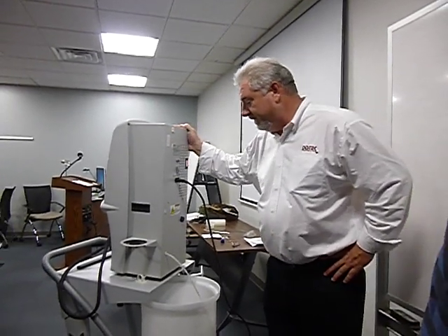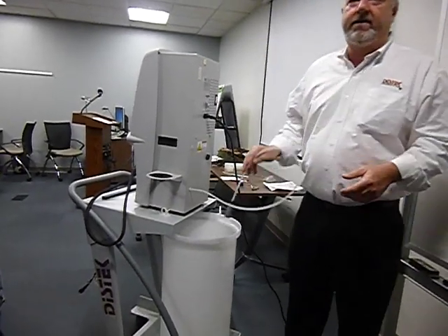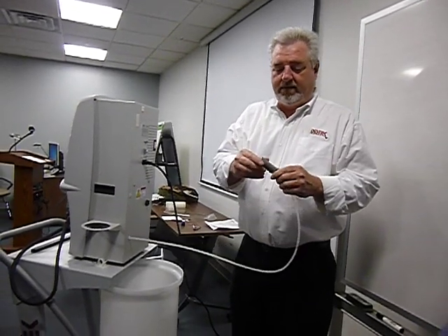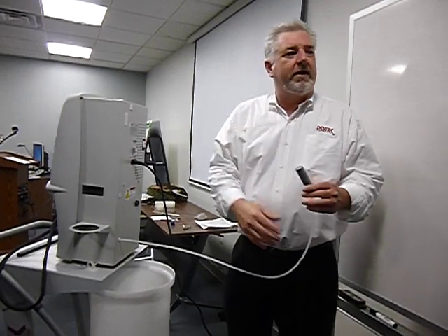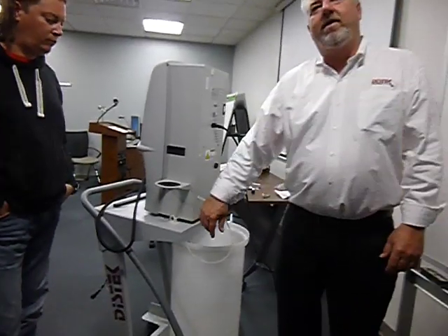So we got this and we put it on. We got a filter here that doesn't go bad. Once in a while it might go bad, but it's always getting cleaned out. Why is it always getting cleaned out? Because it pushes the air, the gas, down through.